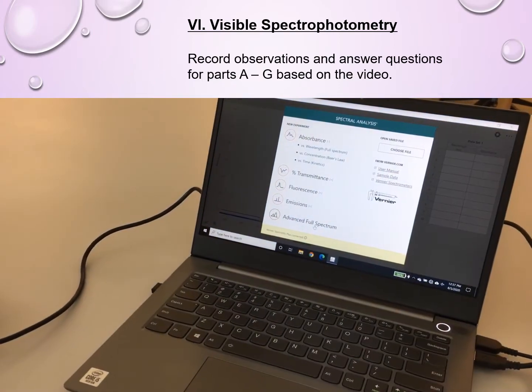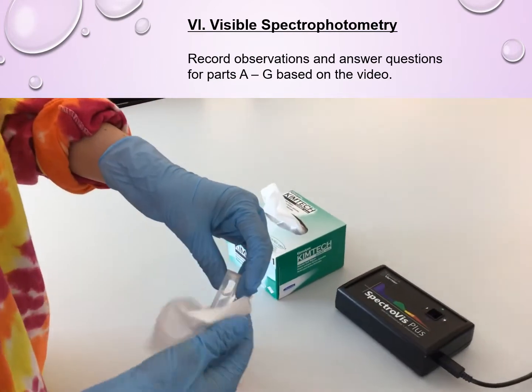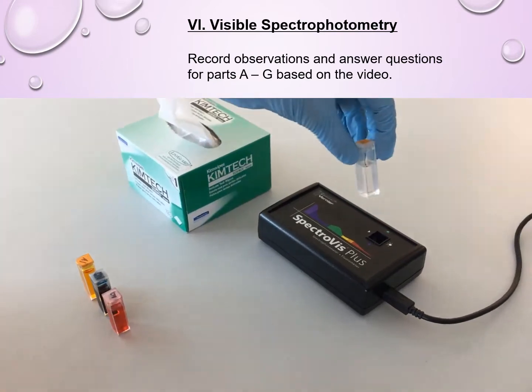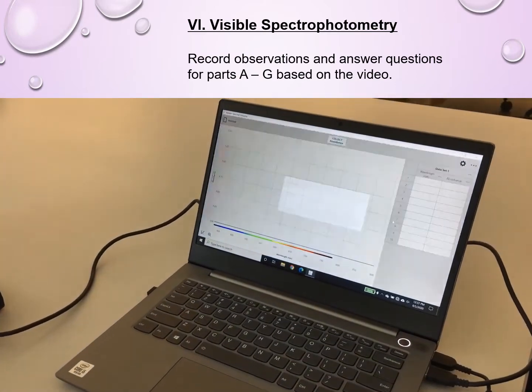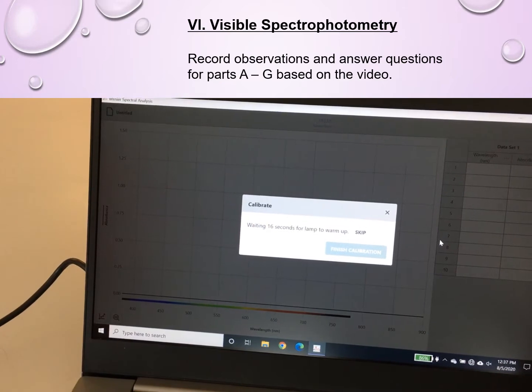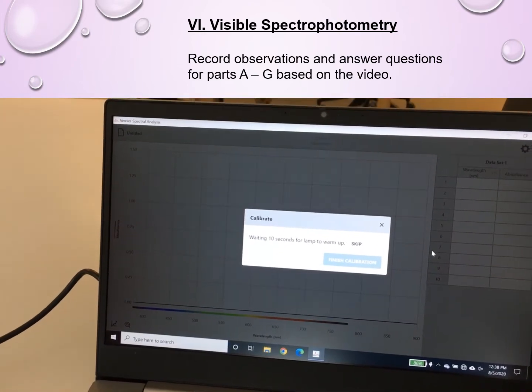We then need to set up the program to measure the full spectrum of the absorbance for these different samples. The first step is to calibrate the device, which is the equivalent of taring and zeroing the absorbance spectrum. So Emily first wiped the cuvette to make sure it's clean, and then she placed it with the clear side that does not have the ridges toward the path of light.